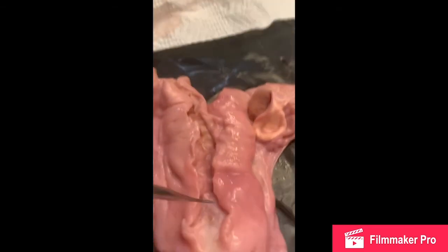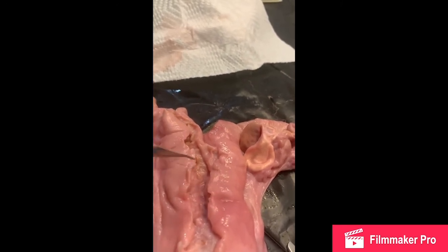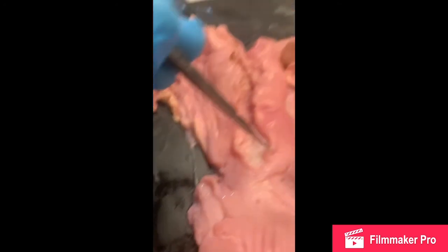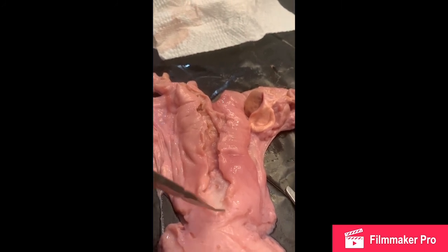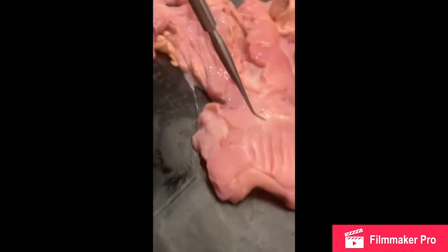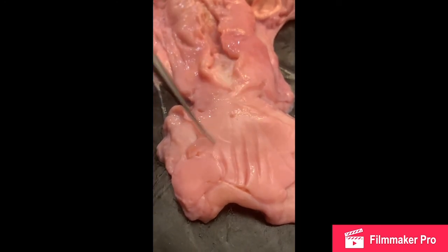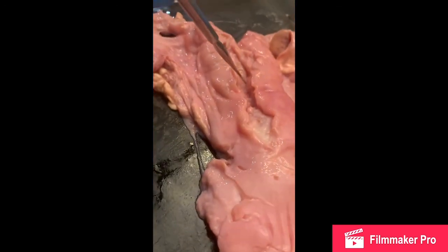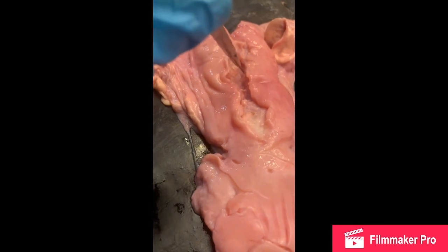But yeah, you can see all the different parts of the cervix that would help in pushing the child out once it's fully developed, and then going down here. We only have the upper portion of our vagina, which we can see here. And as you can see, the kind of cervix that we have in our bovine.